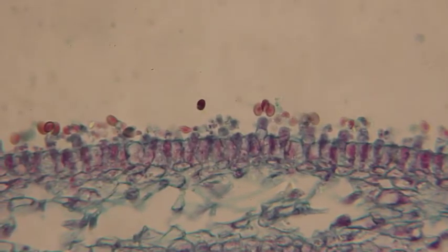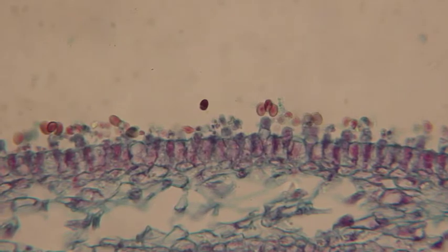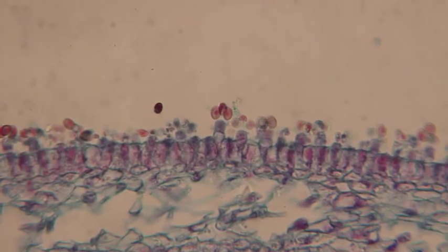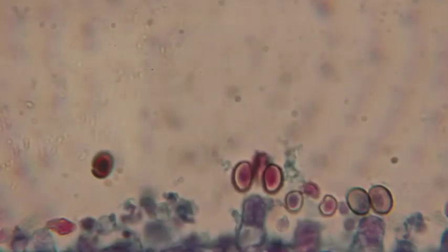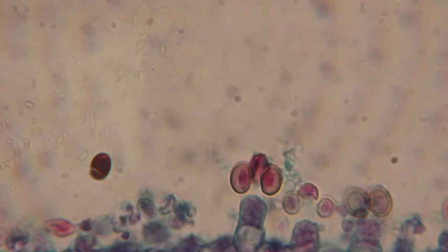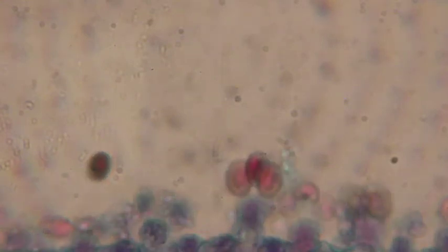What I need to do is put a little bit of oil on it and we'll go up under oil immersion. I'm going to go halfway between the 40x and the 100x magnification, put one drop of oil right on the microscope slide, swing in my 100x magnification and then focus. And there we go — we can see that nicely. You can see how there are three spores easily on it, with one directly behind that middle spore.